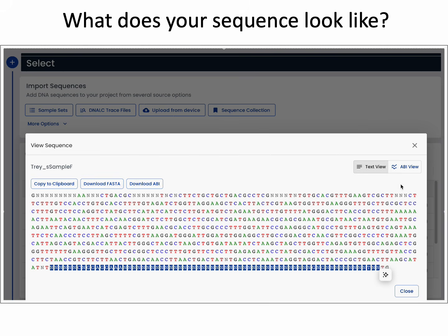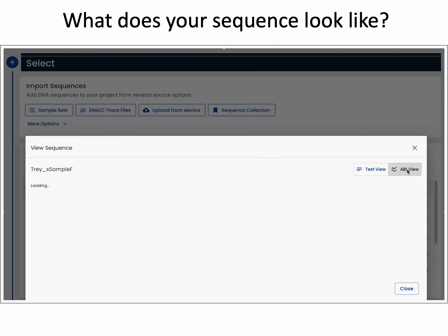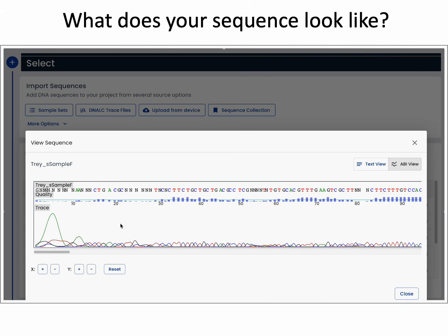If you click on AB1 view, you can see the normal sequence view or the electropherogram. Running along the top will be the individual base calls. In the middle, you'll see a quality score for each of those base calls. The blue bars represent the quality for each individual call, and the small blue line running down the middle represents a threshold, what's called the Phred score.